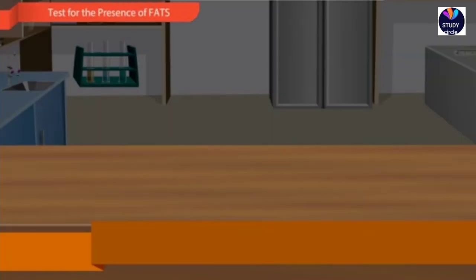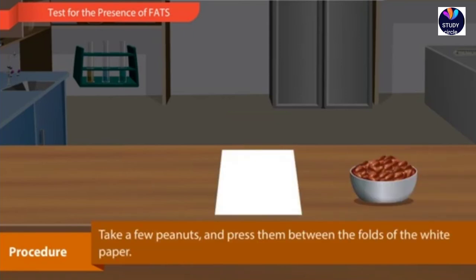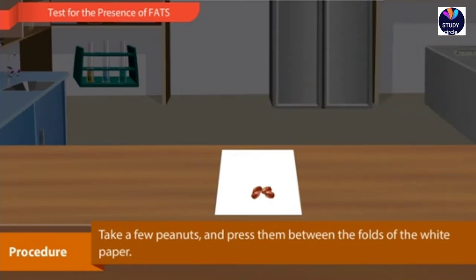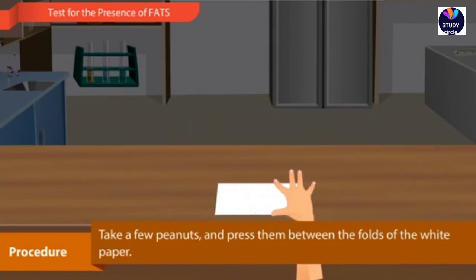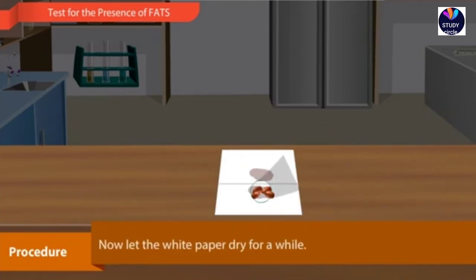Test for the presence of fats. Procedure. Take a white paper. Take a few peanuts and press them between the folds of the white paper. Now let the white paper dry for a while.